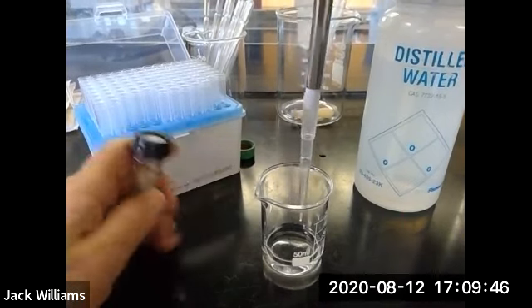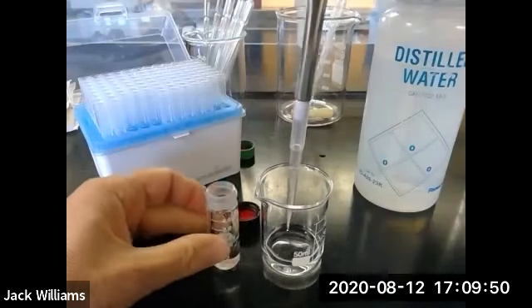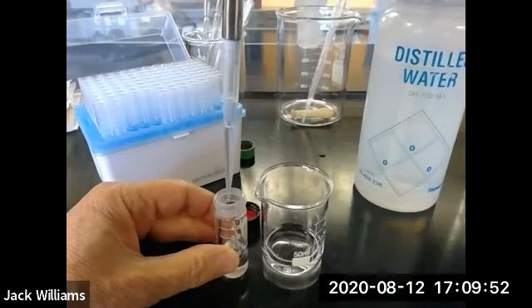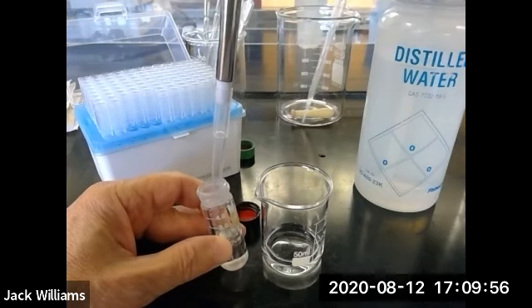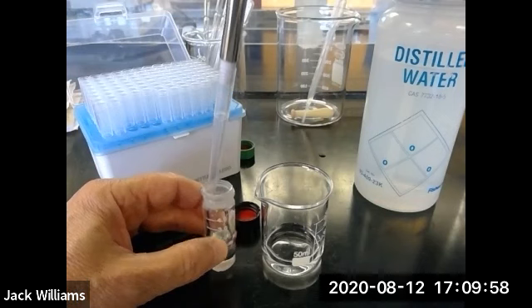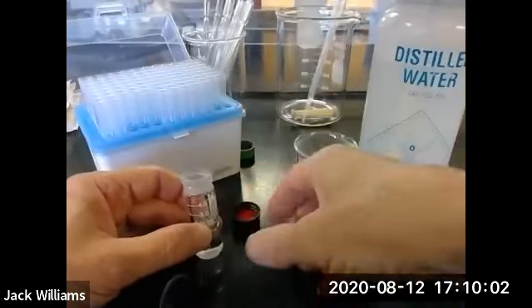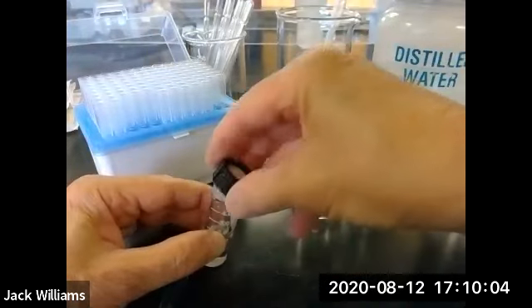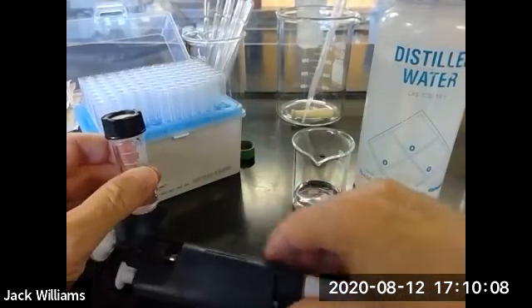Well, that looks pretty good, so we can open up this. And we can transfer very nicely, and down to that second stop to get that last little drop. And we want to cap right away. I'm putting the pipette on the bench top.